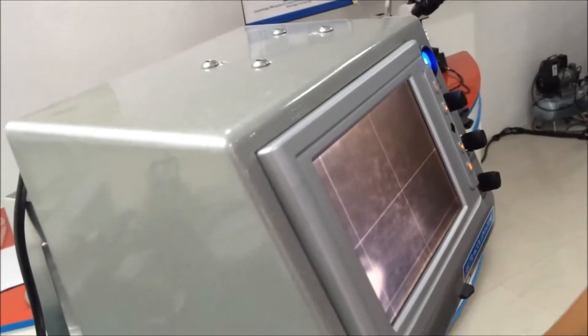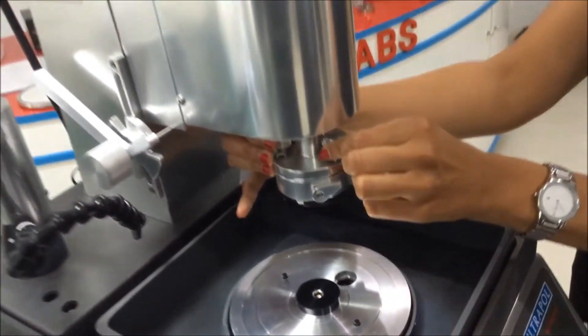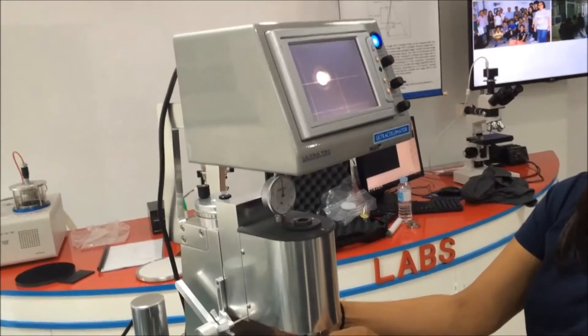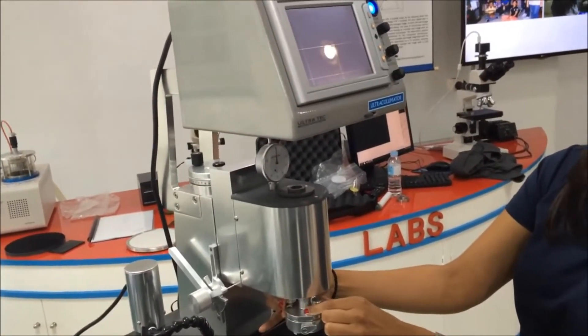And then at this point, you can use the tilt knobs to find the center of that rotation. So we were right here. So I'm adjusting the screws so that I can find the center.